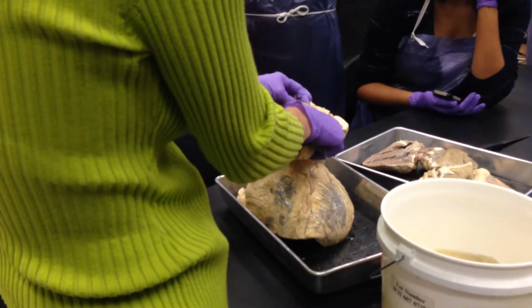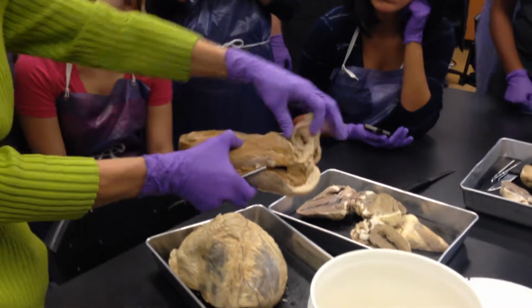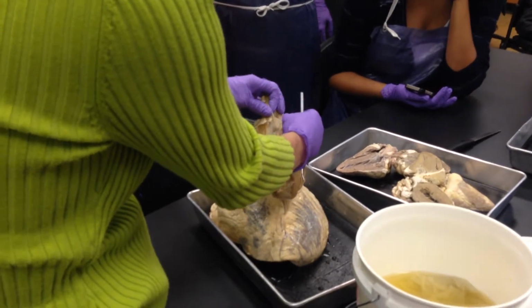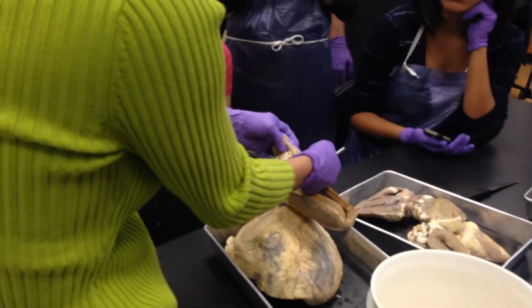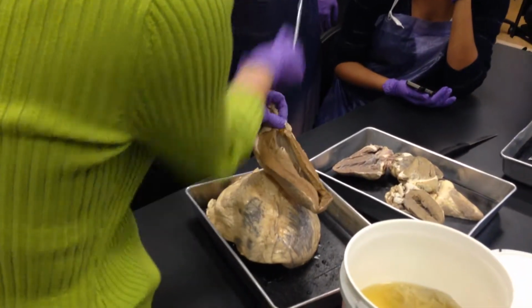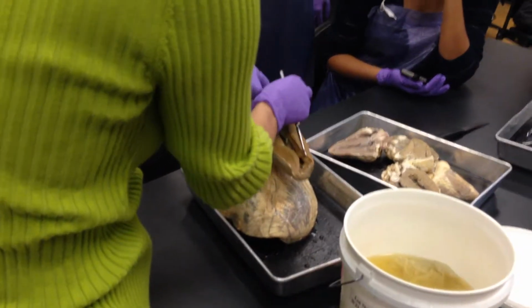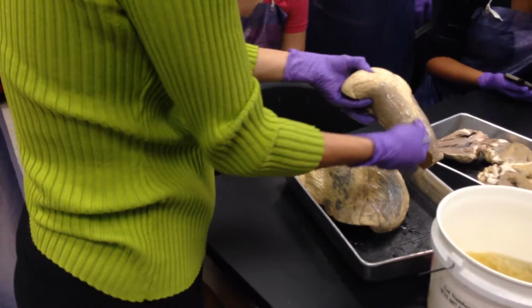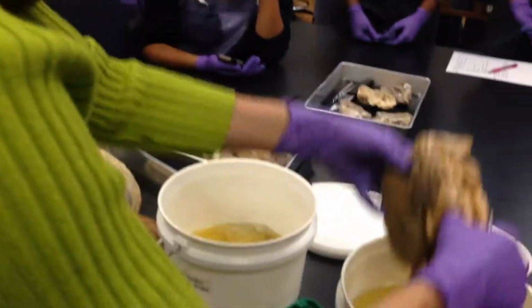Can you see the semilunar pocket or valve there? Can you see that one semilunar pocket or valve? And then here's another semilunar pocket or valve. See those two? When blood fills these, see how it puts the walls up against each other? And that's how you prevent the backflow of blood. If blood is flowing this way out, if it tries to come back, it fills those pockets, and then those pockets just shut across one another, right? Identify that structure right there. Anterior interventricular sulcus.